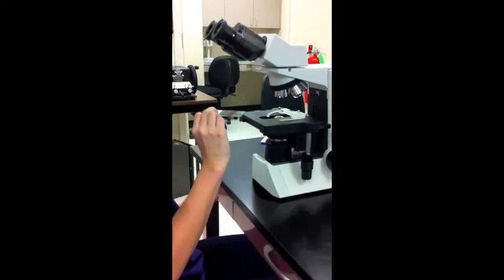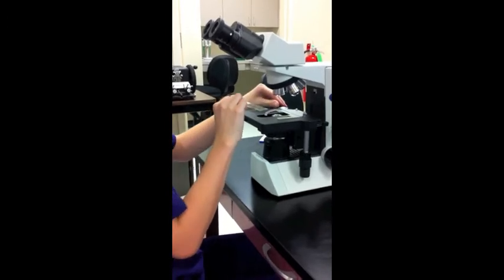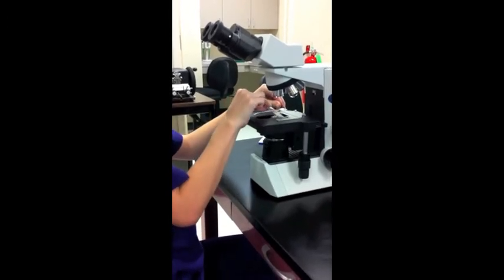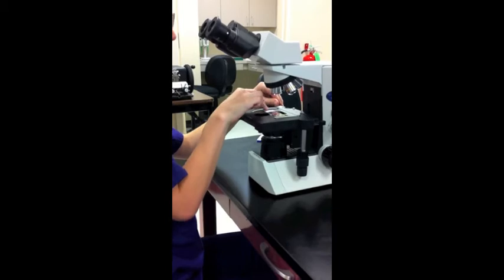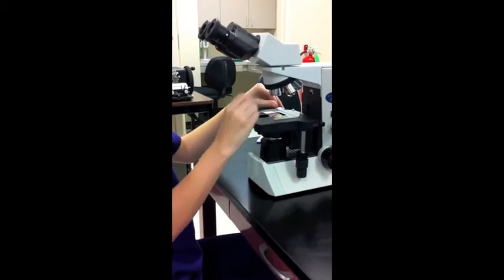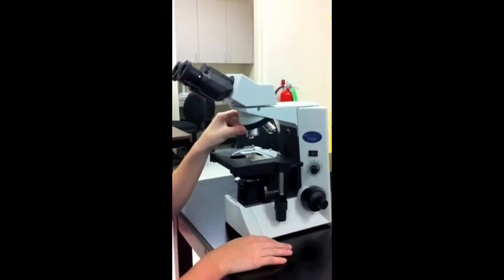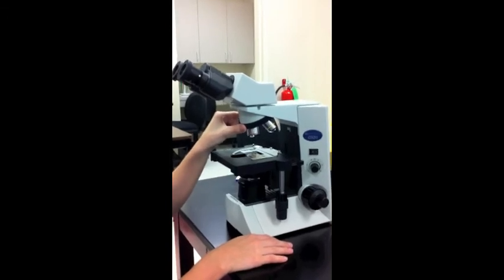Number four, place slide specimen on the stage and secure within stage clips. Five, click the 4X objective into place.